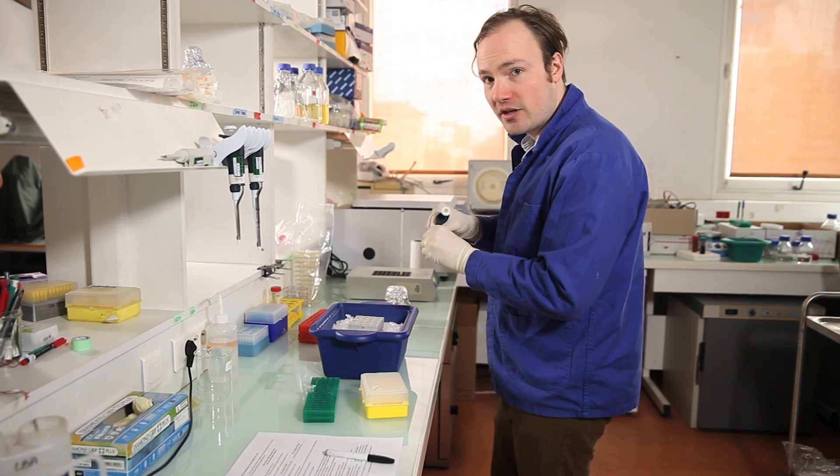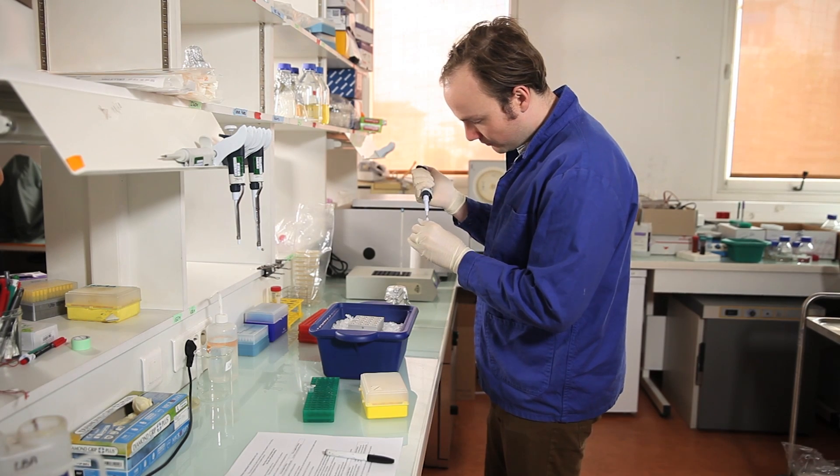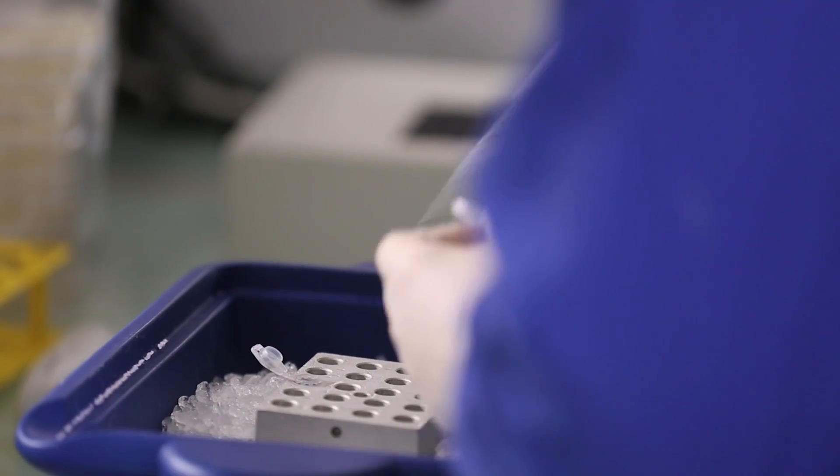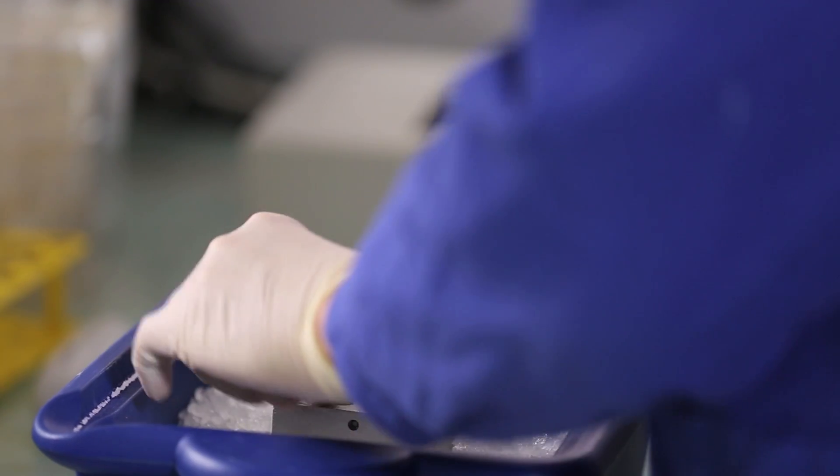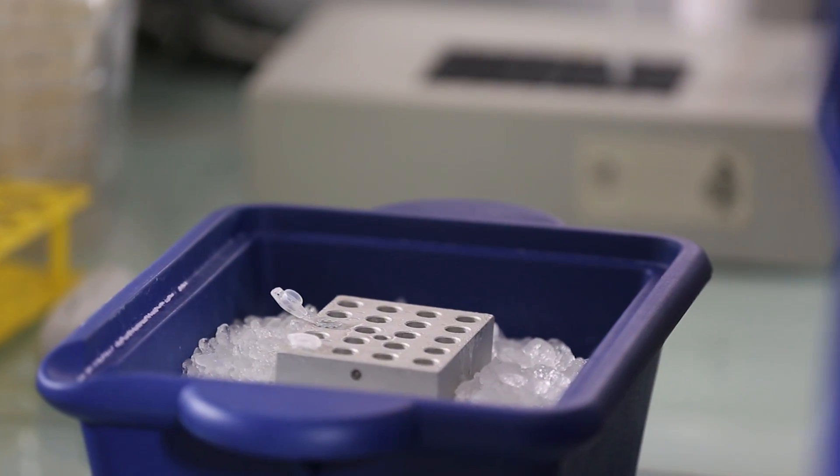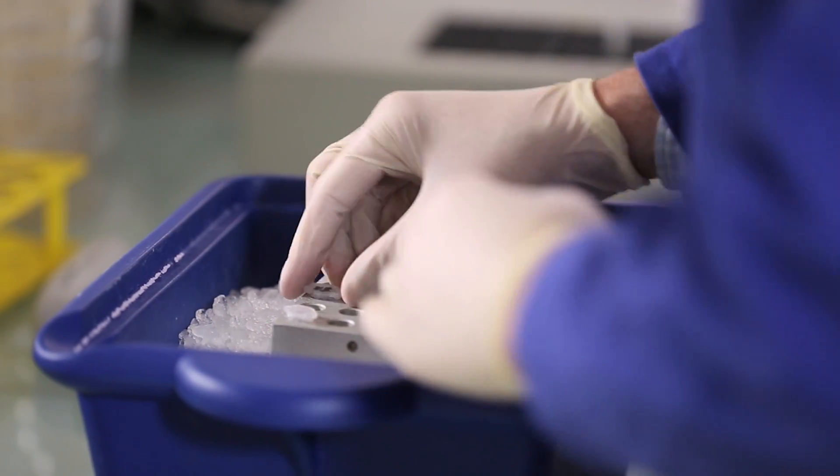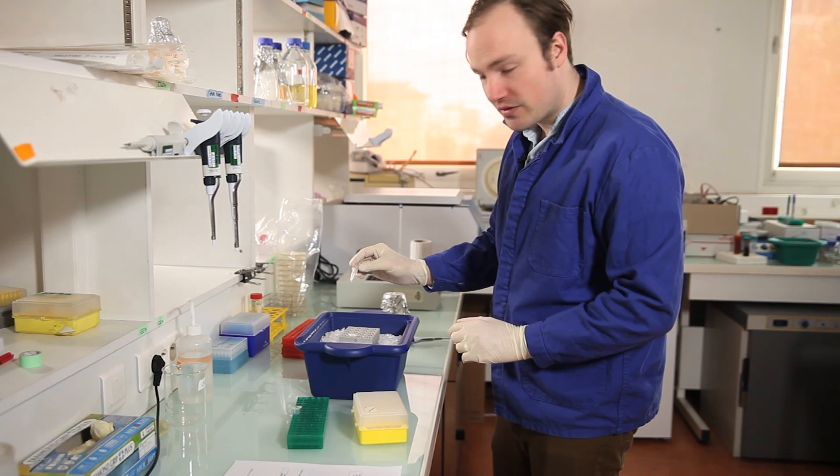So we're keeping everything cold for this. Okay. So there's my 20 microliters of cells.